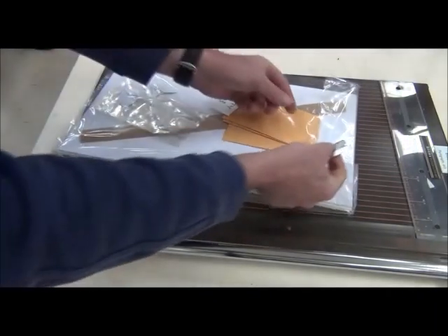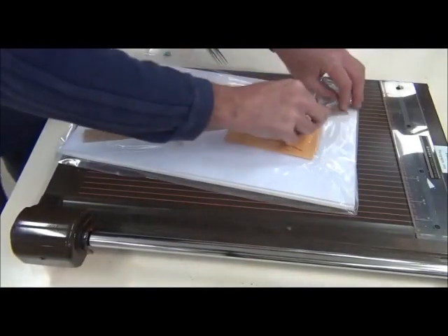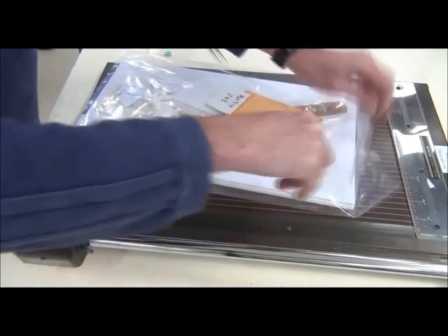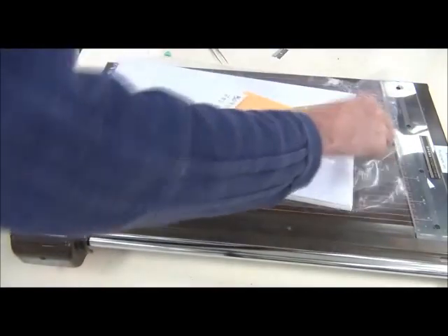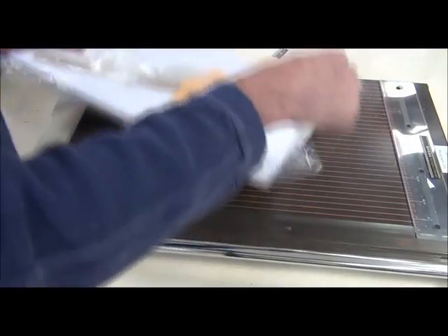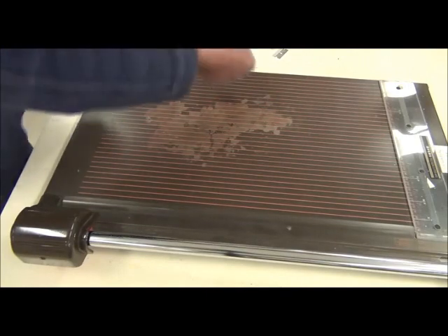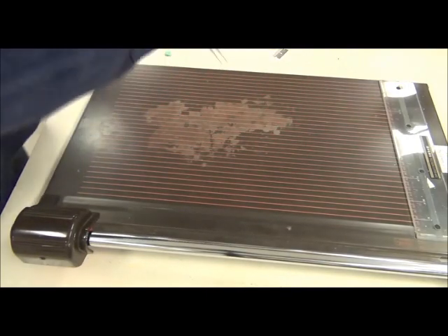Hello, so what I'm going to show you now is how to mount a specimen. I'm undoing one of the kits that you had and the first thing I'm doing is I'm grabbing the brown gluey paper. You can see one side shining.